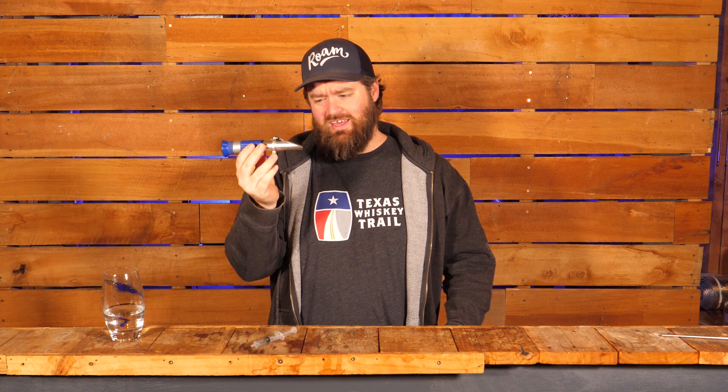How's it going chasers? I hope you're having a kick-ass week. Today I want to talk about this little guy here — this is a refractometer. I want to talk to you about why I love these things so much, the advantages of them, the disadvantages of them, how you use them, and the giant traps you can fall into if you don't know what you're looking out for with these things.